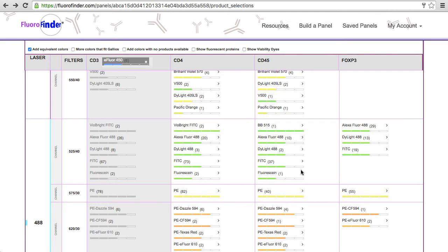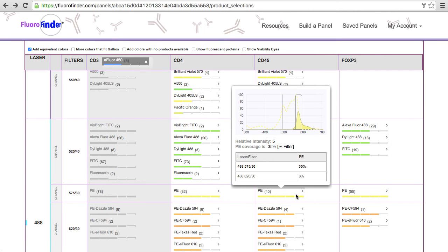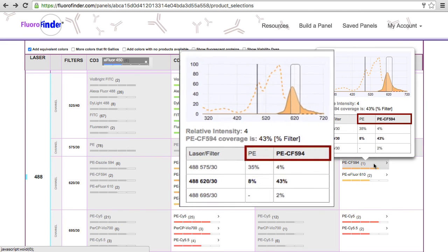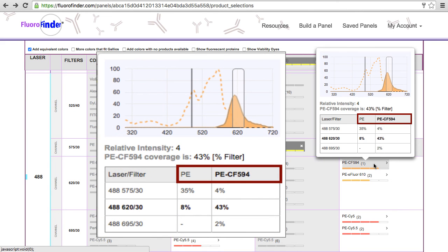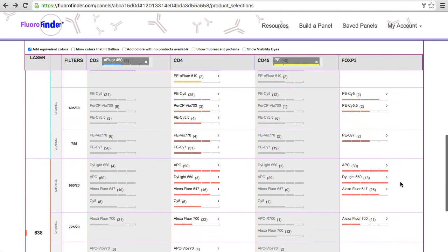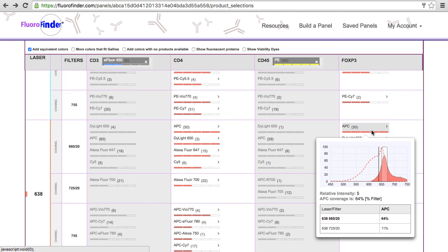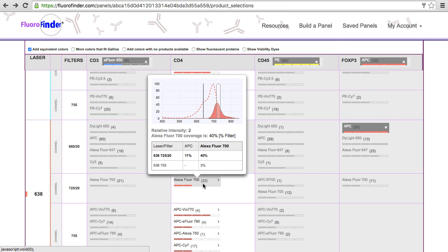As you start choosing your products, pop-ups may include percentage filter values for multiple fluorochromes. Now you have the ability to view all of this information from different vendors in one place. FluoroFinder enables you to predict spectral overlap for your fluorochromes of interest and filter combinations on your exact cytometer. By providing you with information about the optical background for a particular detector, you can more intelligently select your color combinations.